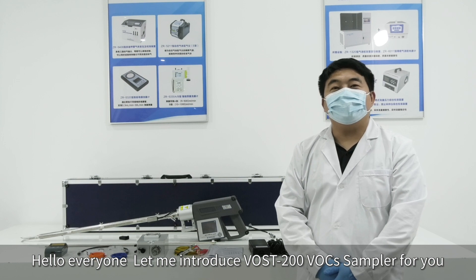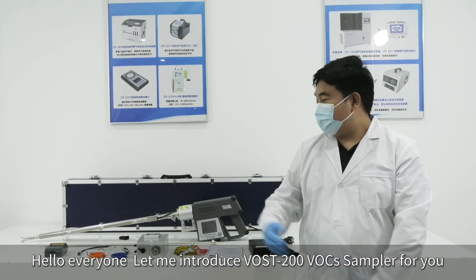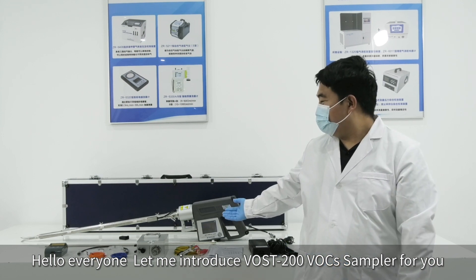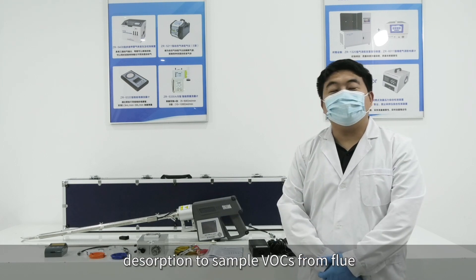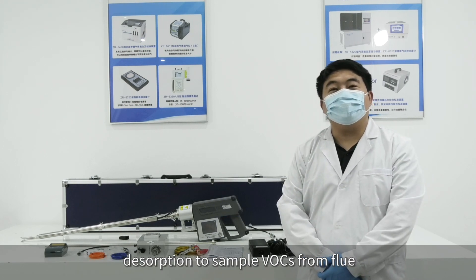Hello everyone, let me introduce the VOST-200 VOCs sampler for you. It uses sorbent adsorption and thermal desorption to sample VOCs from flue gas.